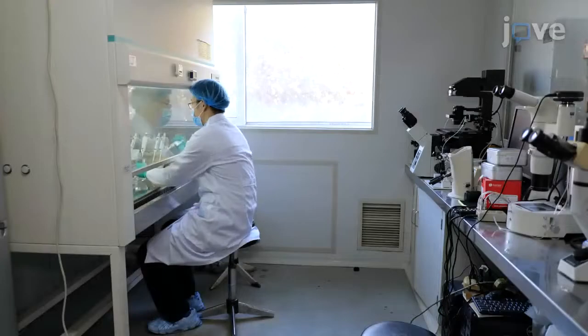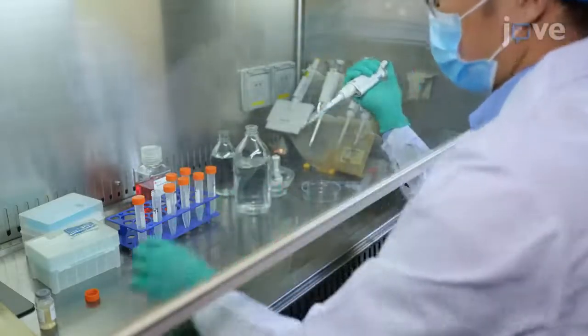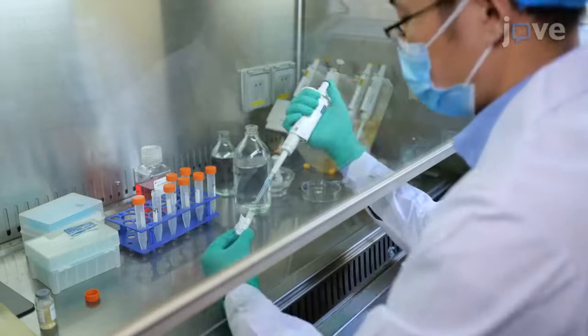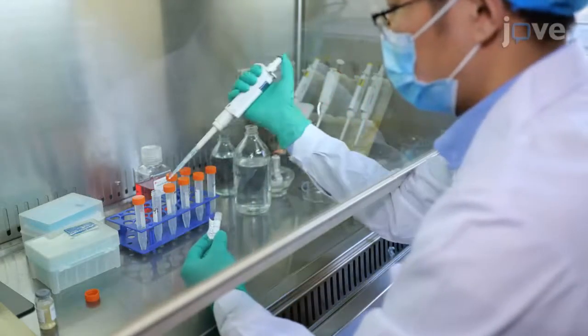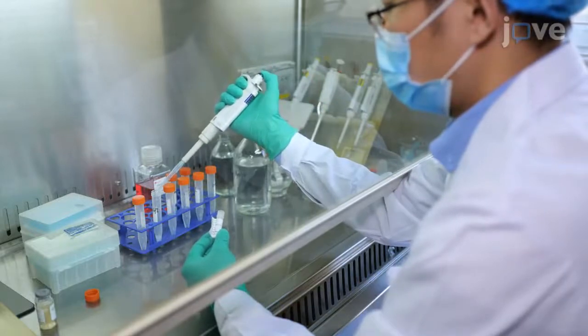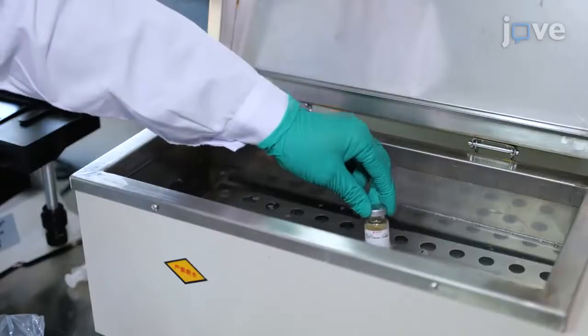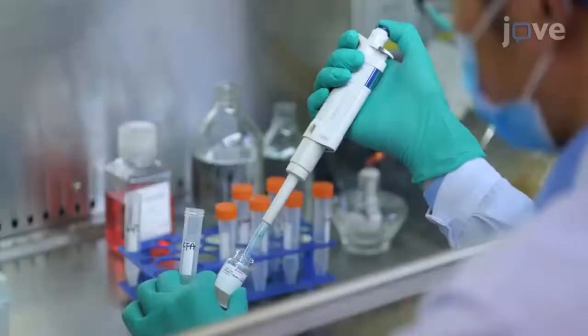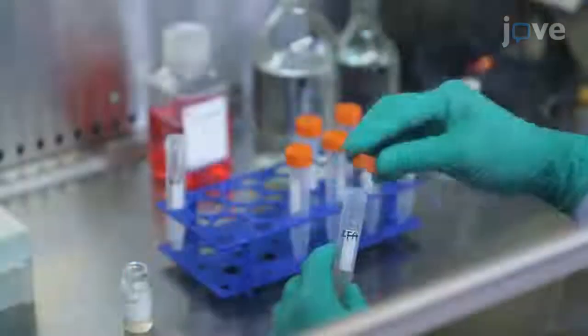To begin, weigh 1.75 milligrams of both G6PI 325-339 and G6PI 469-483 fragments and dissolve them in 5.25 milliliters of 4 degrees Celsius triple distilled water. Dissolve complete Freund's adjuvant in a 50 degrees Celsius water bath. Draw 5.25 milliliters into another 10 milliliter centrifuge tube and cool it for use.